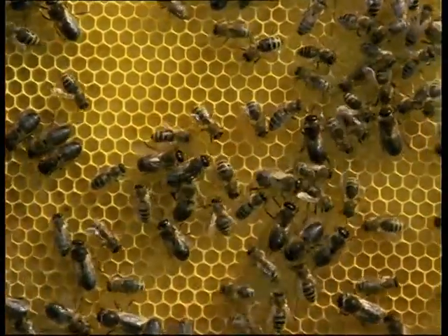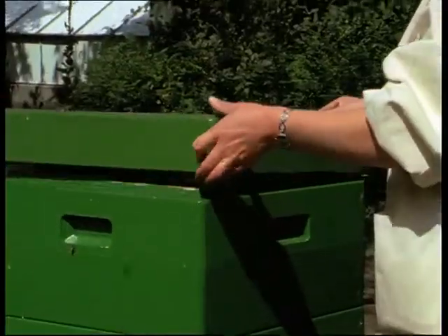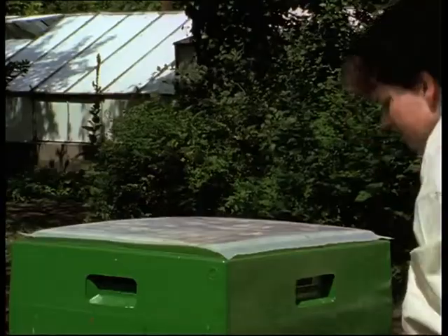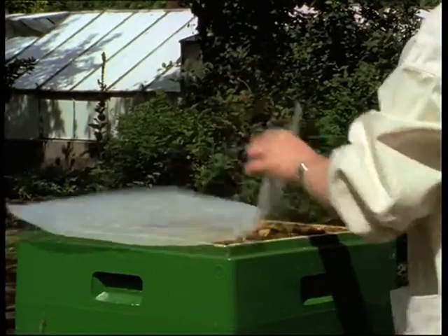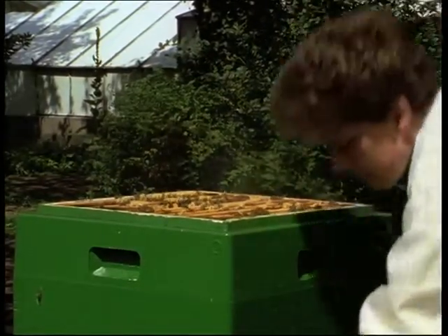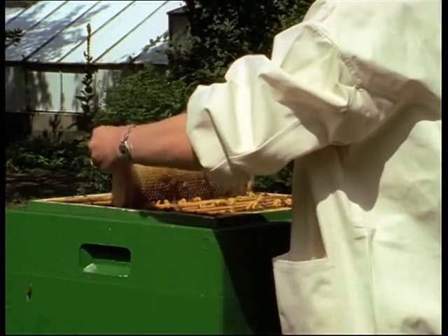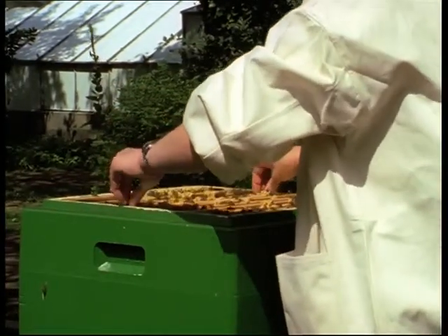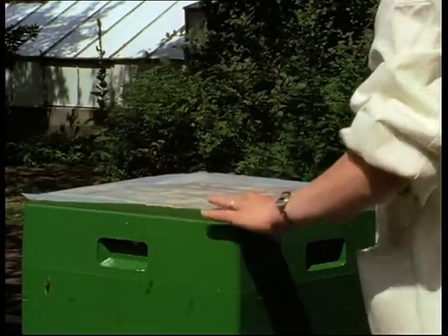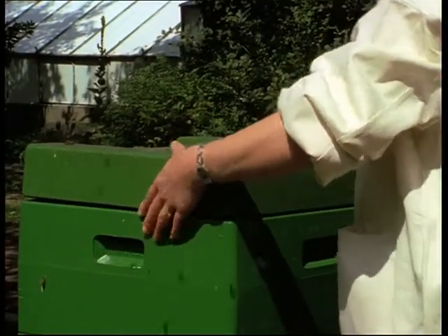It is essential for the donors to be fully mature. The readiness of a stock of bees to rear and feed drones depends largely on outside influences such as weather and available food supplies. An empty comb with drone cells is placed in the drone colony about 50 days prior to the proposed insemination date. As required, stimulation is provided by feeding or dequeening it.